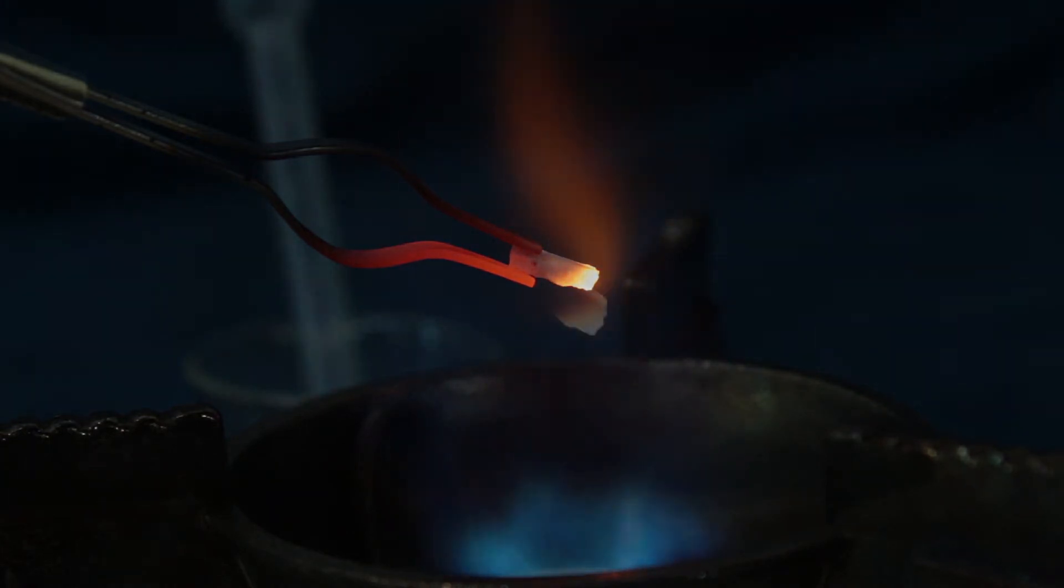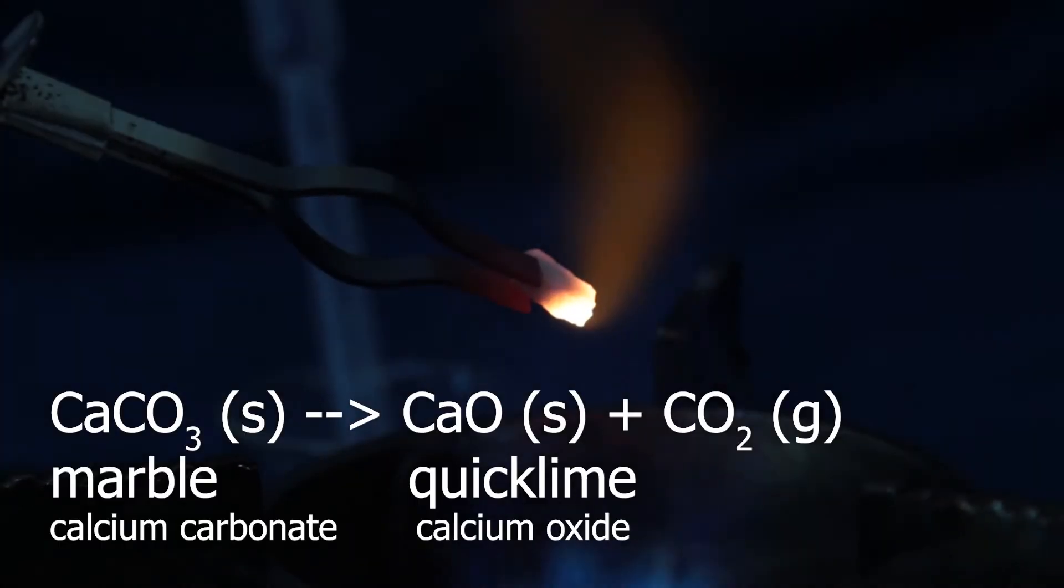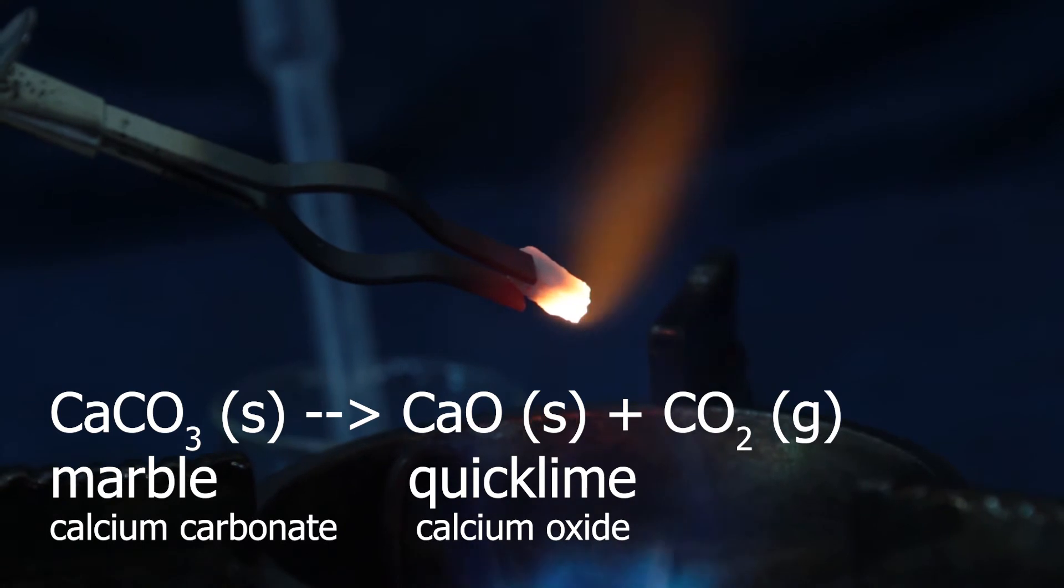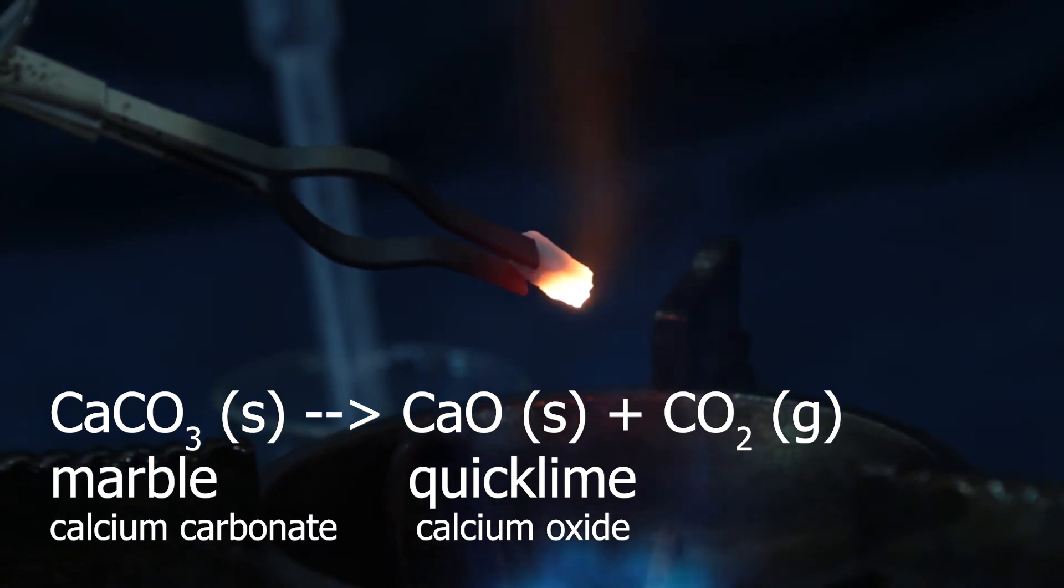So, I need few minutes to make sure that calcium carbonate decomposed. Again, calcium carbonate solid makes calcium oxide solid, as well white, plus carbon dioxide gas.